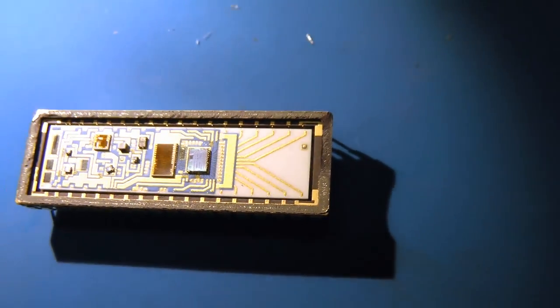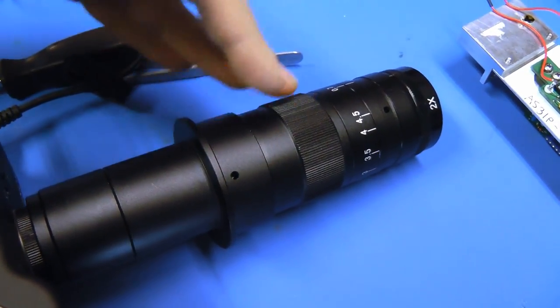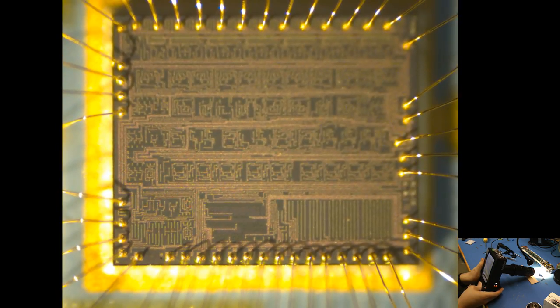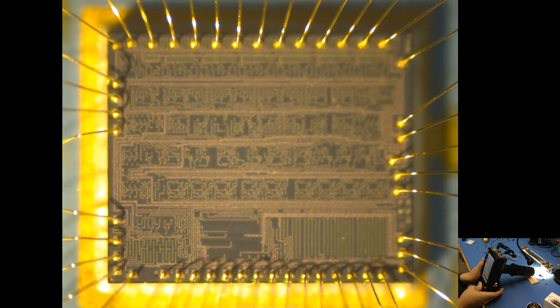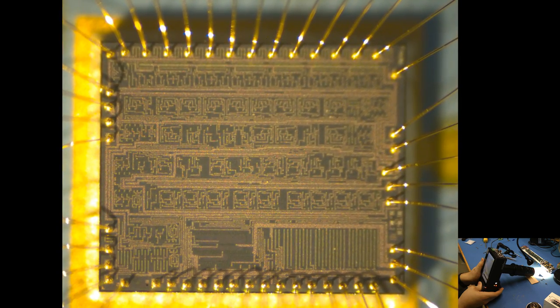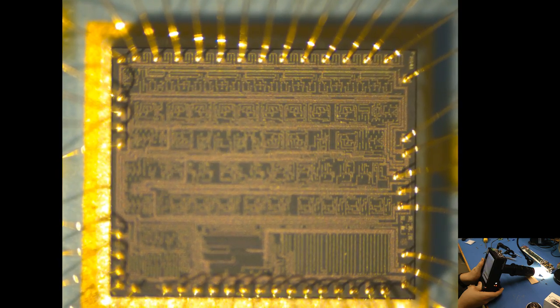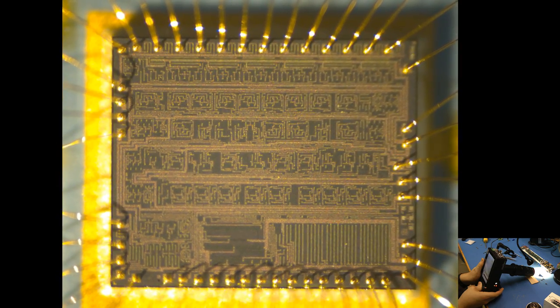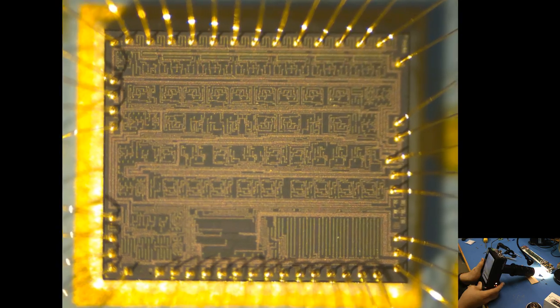So let's take a closer look at these. The best microscope thing I've got right now is actually the Chronos camera with a microscope lens on it. So let's give that a try. So here's a view of the large die on the right. This seems to generally have digital logic on the right side. And then perhaps some sort of analog stuff on the left. It's a little bit hard to get good focus with this setup. But I think this is working pretty well. Let's see if we can zoom in. Get a better look at this. Just to give you an idea of scale, the image is about 2 millimeters wide in total. There's the digital portion. And there's the I'm guessing it's some sort of analog or IO buffer portion.